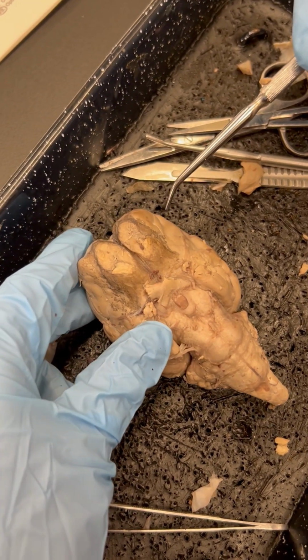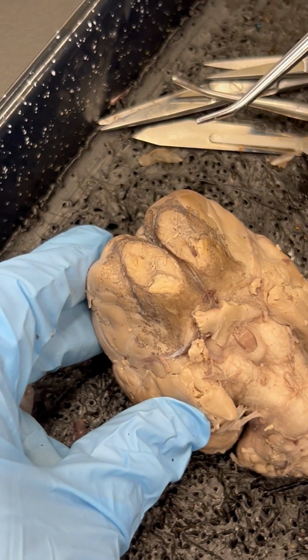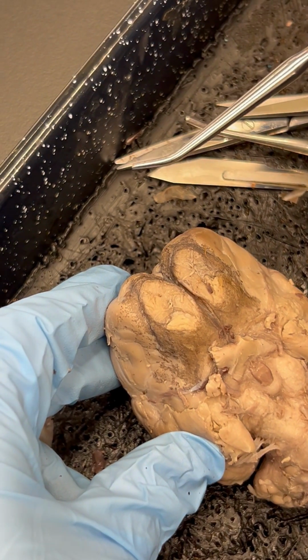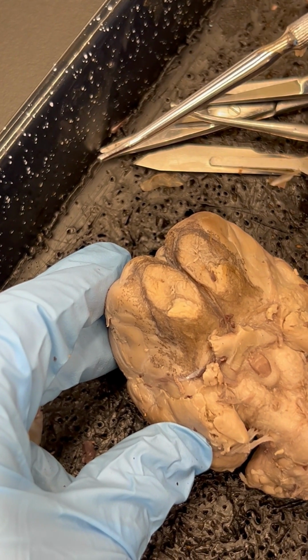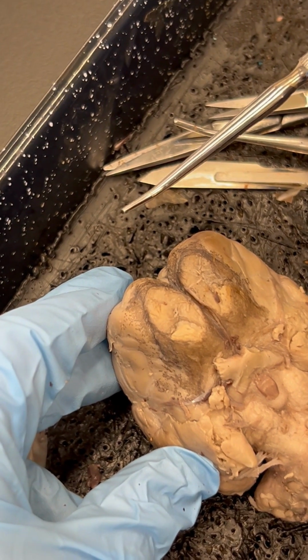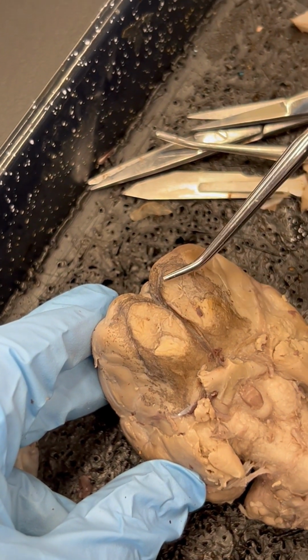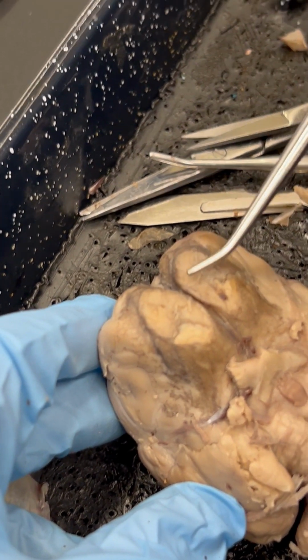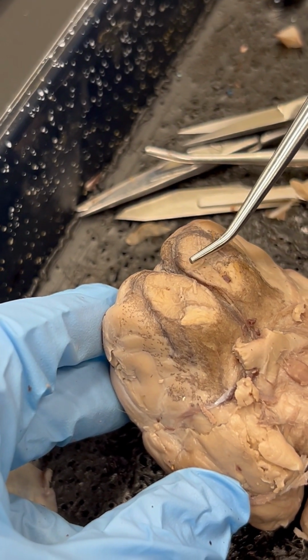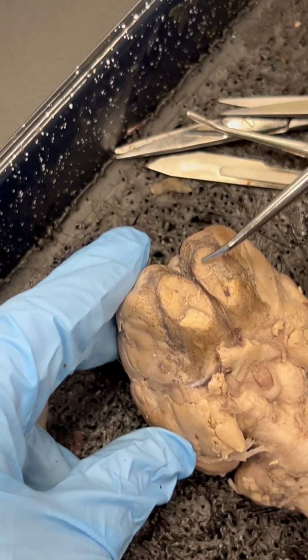So we're going to start with number 1, the olfactory bulb. Some of the specimens we have have the olfactory bulbs removed. The olfactory bulbs in this brain are removed, but they would overlie this region. You can even see the area of the disrupted tissue where they were removed. You'll have to find out in your specimen if the olfactory bulbs are present, but they would overlie this region.